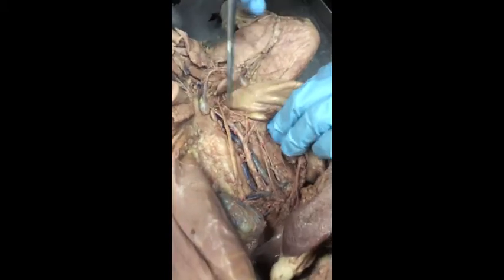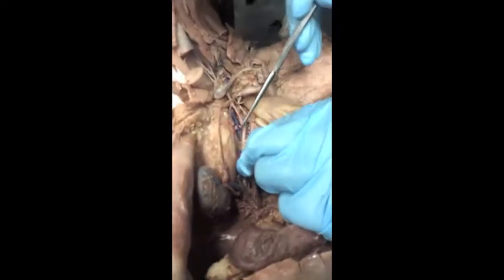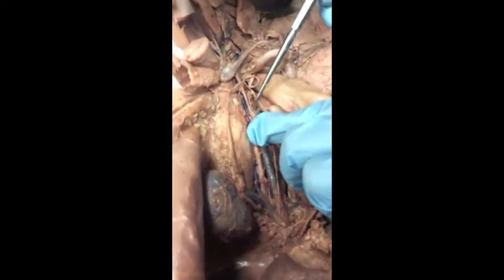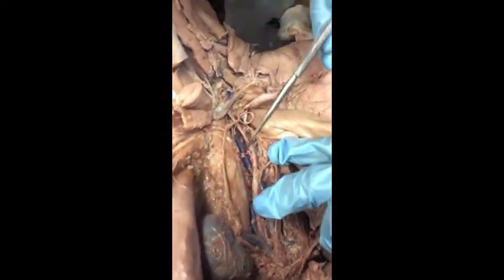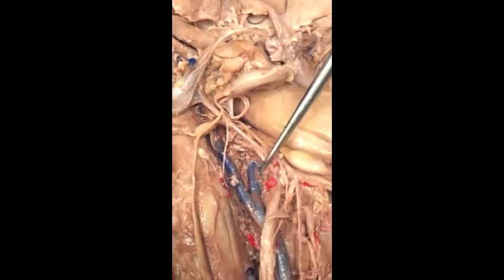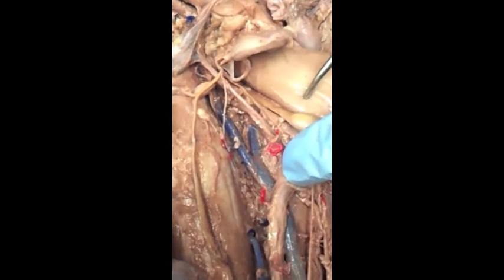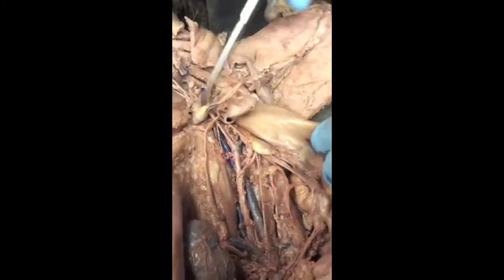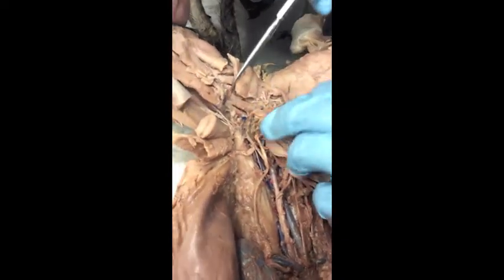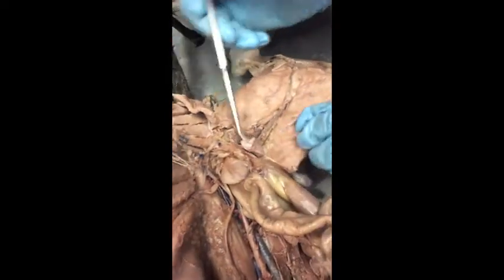If we follow and look at the ends of our aorta and our vena cava, here's our abdominal aorta. It's going to split, and that's going to be your common iliac artery, and the vena cava is going to do the same thing. It's going to split into the common iliac veins, and those continue down into the thigh. Now they are cut on this side, so they're not very colorful and pretty on this side.